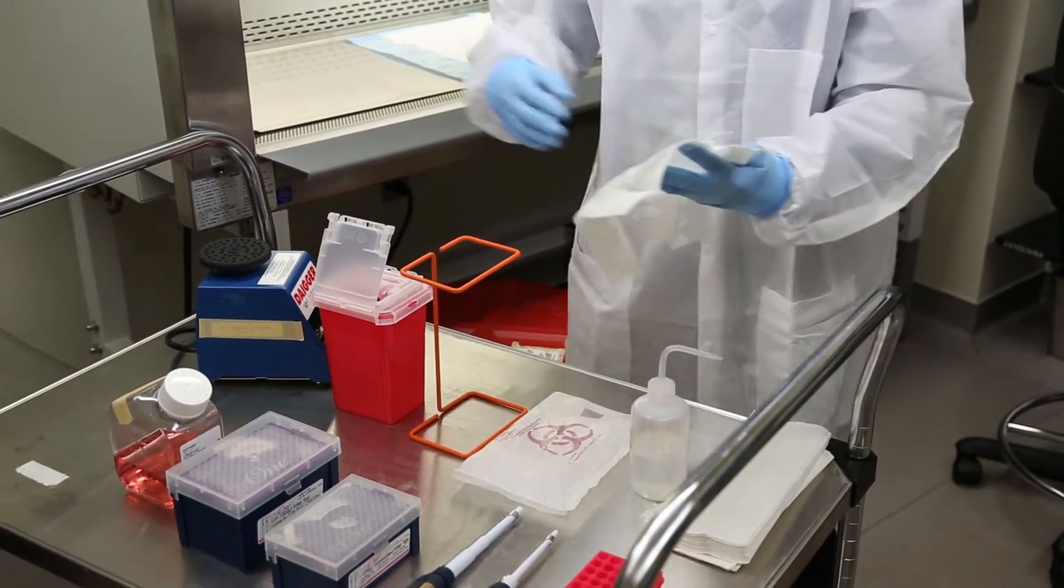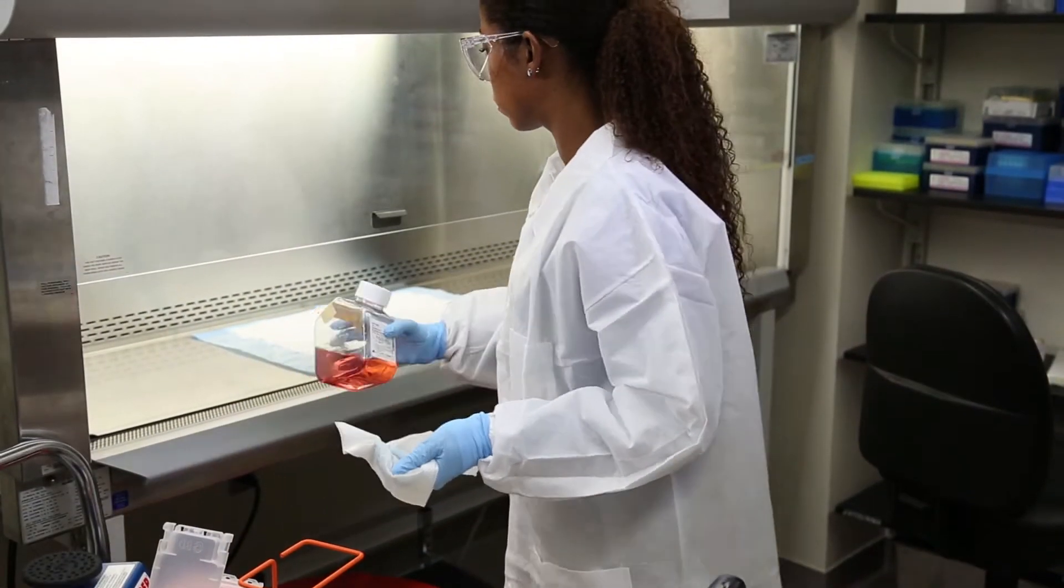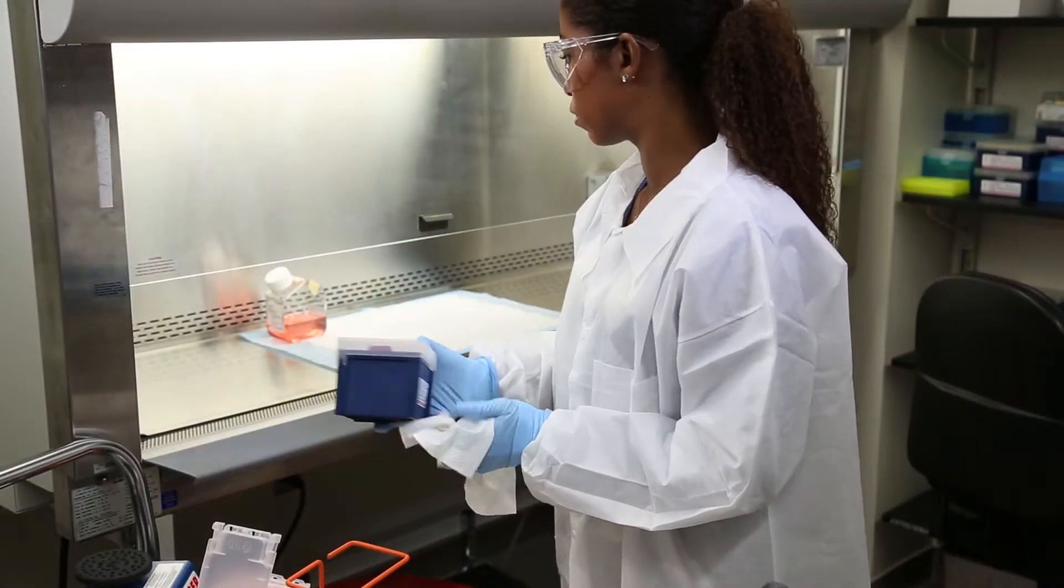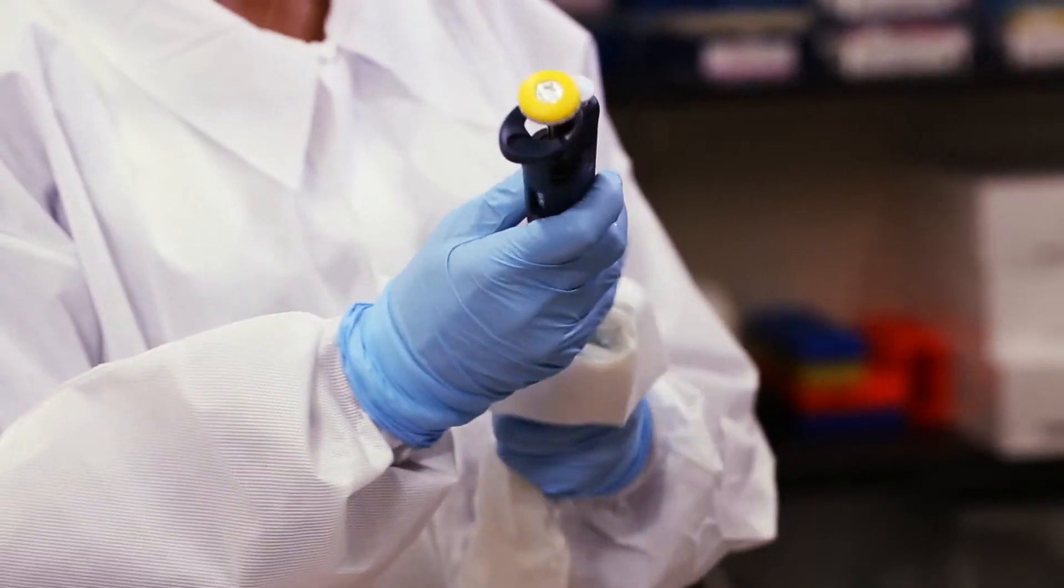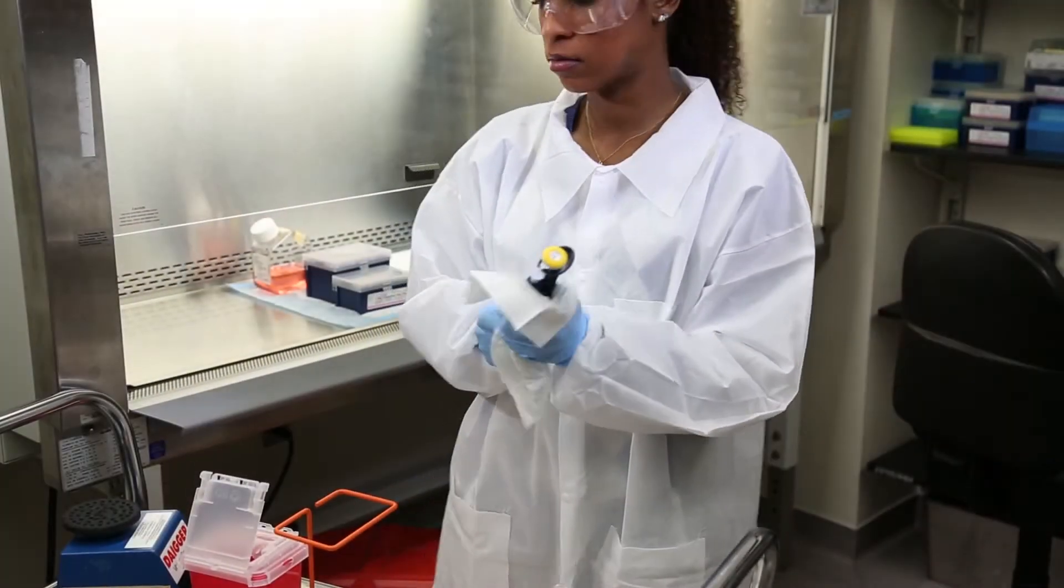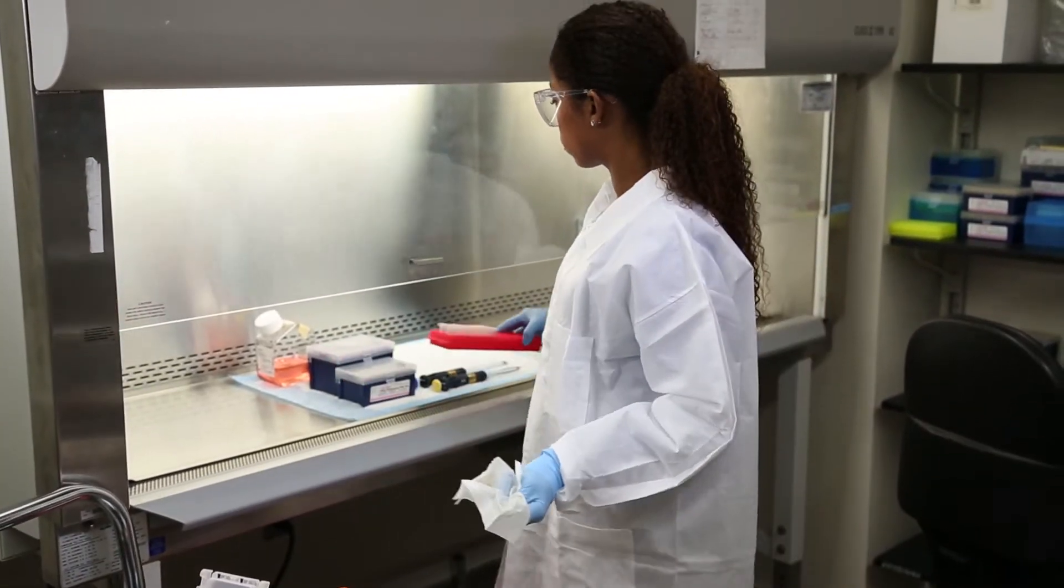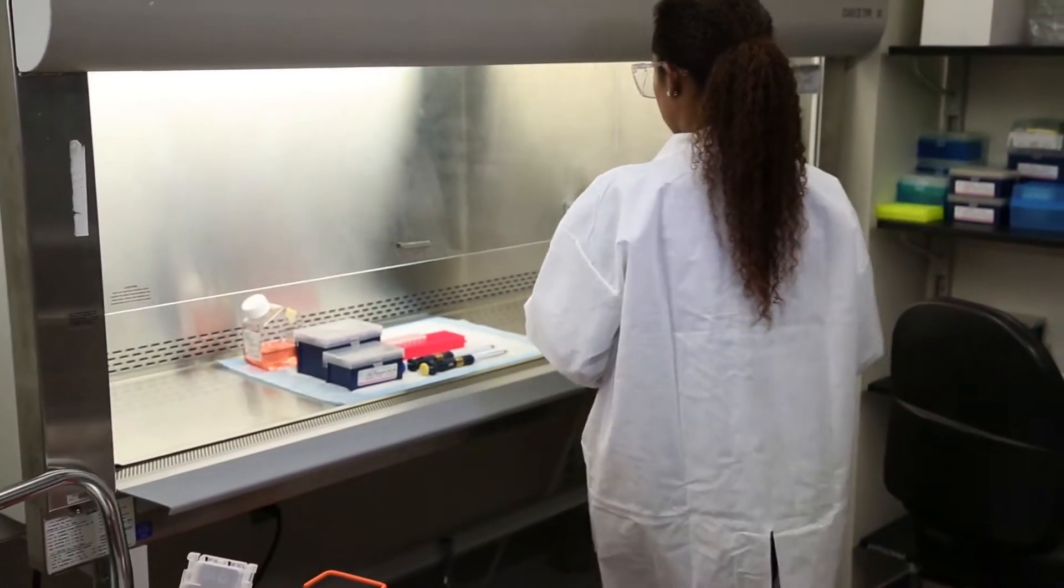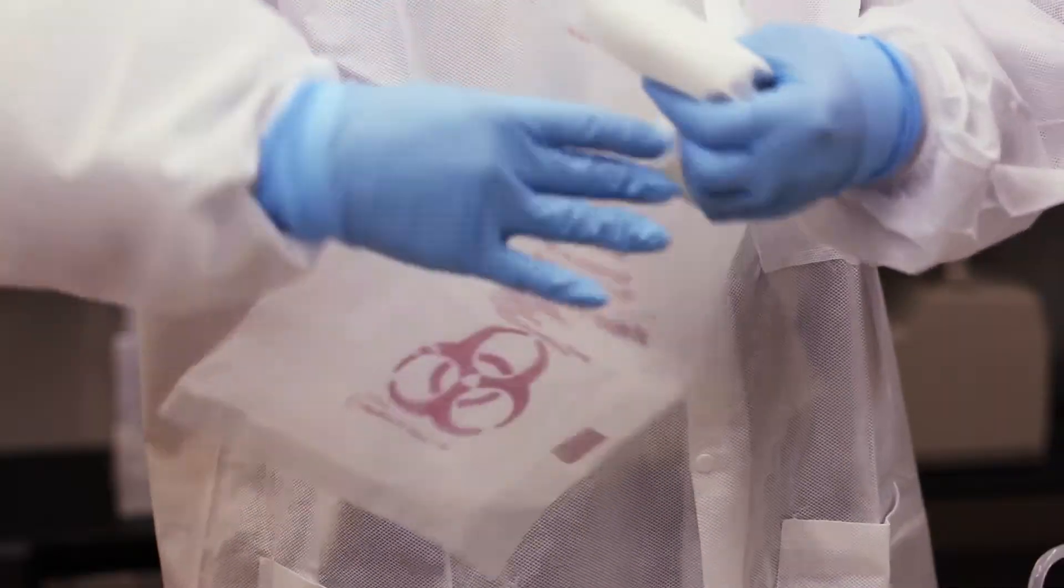Before loading the BSC, it is good practice to wipe the external surfaces of all needed supplies with disinfectant to reduce the introduction of outside contaminants into the cabinet. It is recommended to load necessary materials once in the beginning to minimize your arms entering and exiting while working. Don't forget a biohazardous waste container, sharps container, paper towels, or wipes.